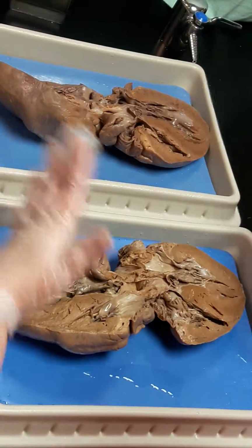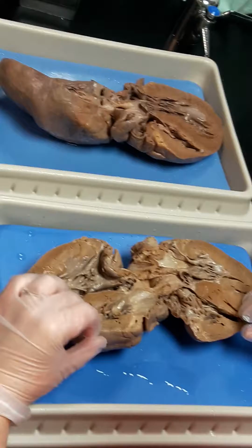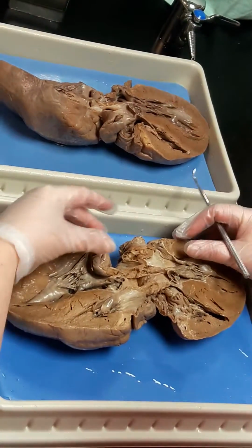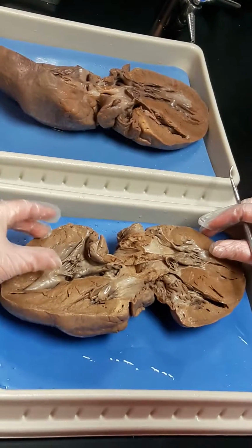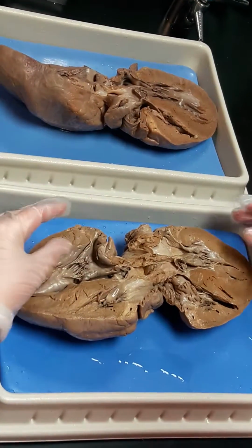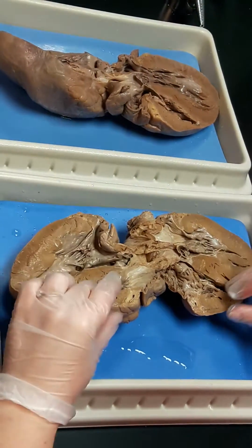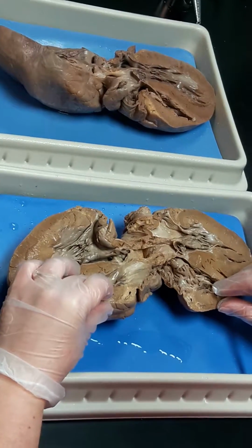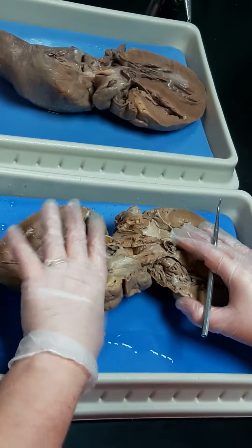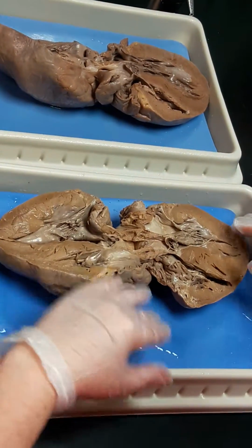Okay, so the first thing you do when you walk up to a heart on the test, or any time, is figure out what's your left versus your right. The best way to do that is look for the thicker wall. The thicker wall is going to be on the left side of the heart because the left side has to pump blood to the entire body. The right side of the heart goes to the lungs and back to the heart, so it doesn't have to work as hard. I'm actually going to do two things and then we'll walk through the blood flow.